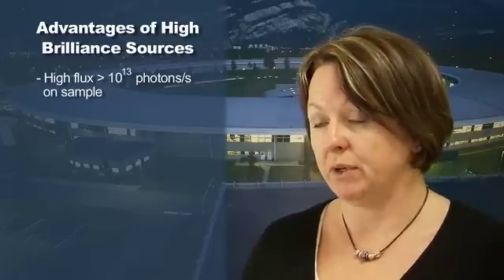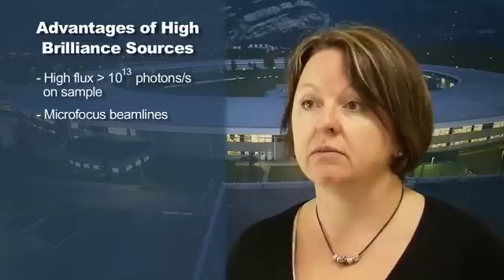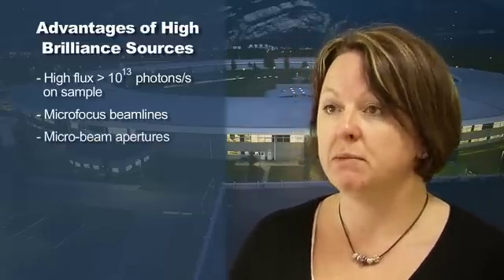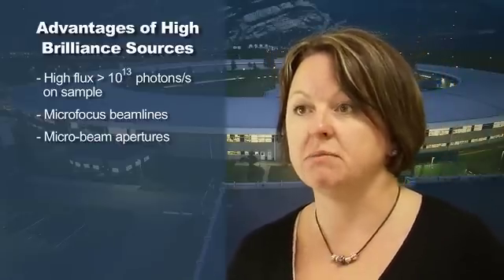The synchrotron has very high intensity x-rays, so we can use smaller samples, and we can also carry out much quicker data collections. We have microfocus beam lines where the sample size can be as low as 5 microns. We have micro beam aperture beam lines where we can actually change the beam size, so we can match the beam size to the sample size.